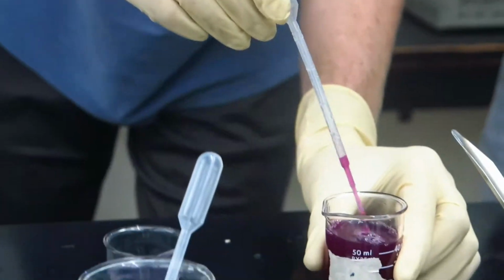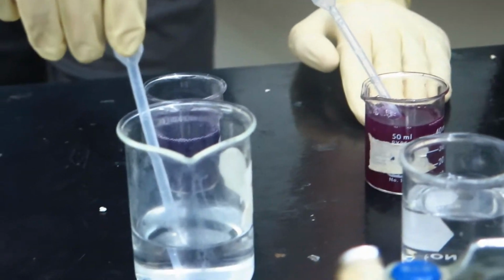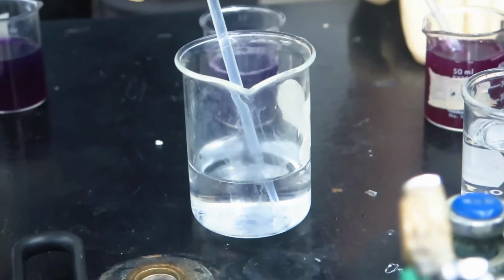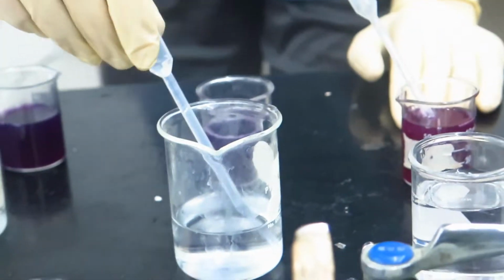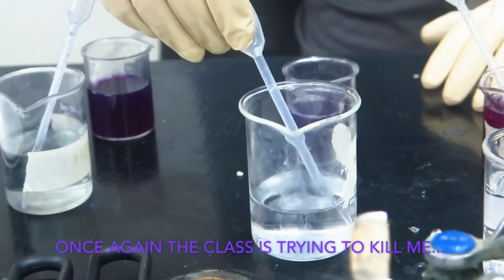These next two are ones that you don't want to drink. And I have gloves, so I'm going to do these ones. This is sodium hydroxide.